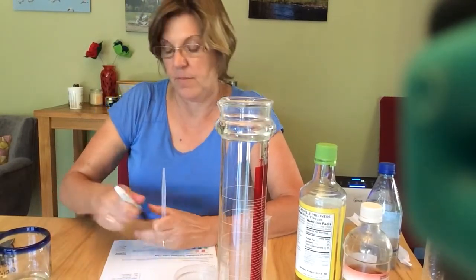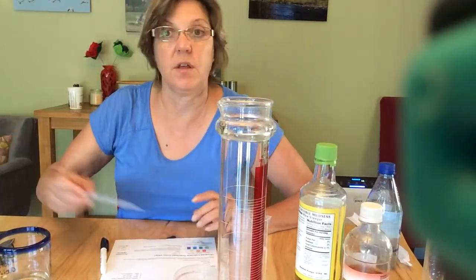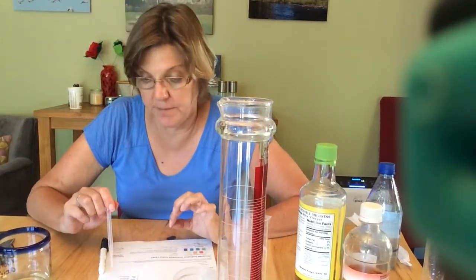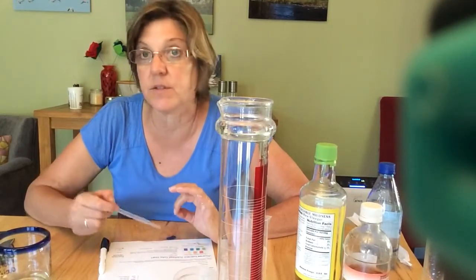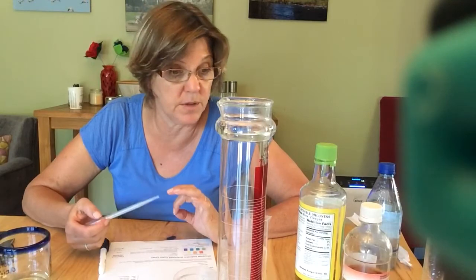Okay, all right, then I'm done with my experiment. What I want you guys to do is put this data on the Google Doc so we can have a whole bunch of different types of waters that we can be comparing.